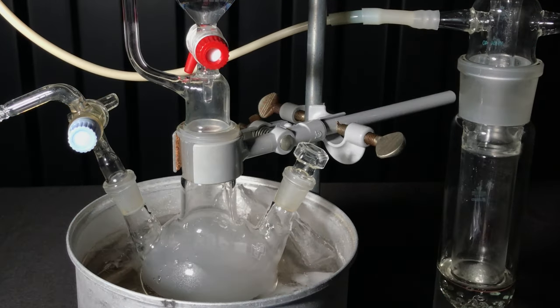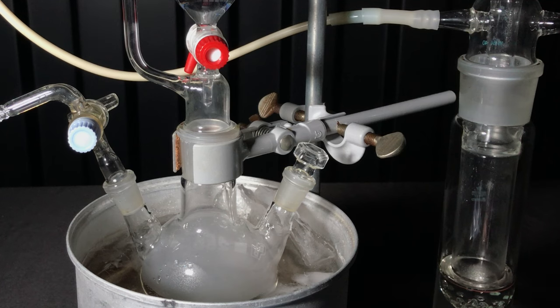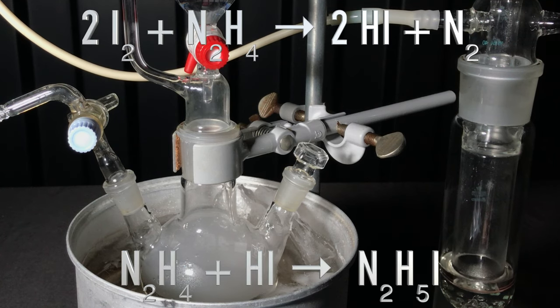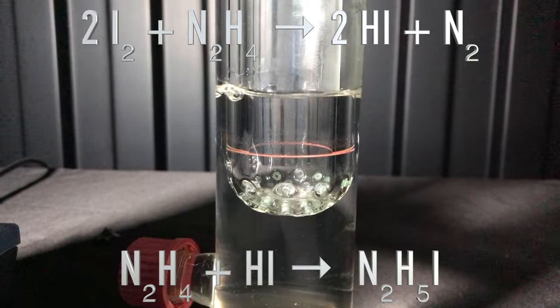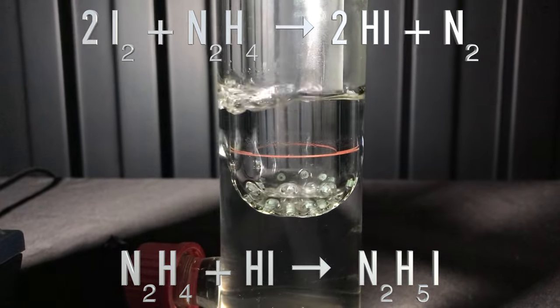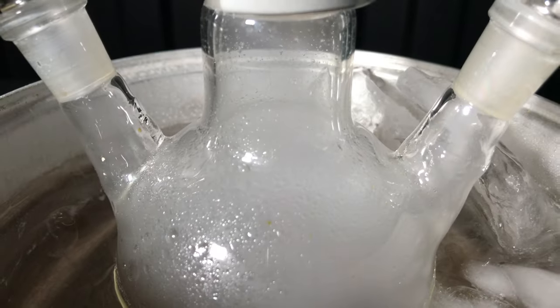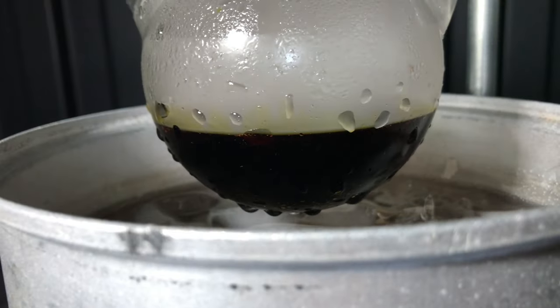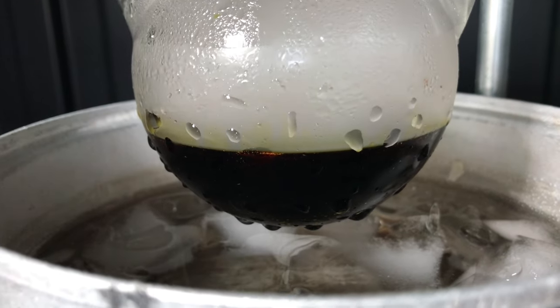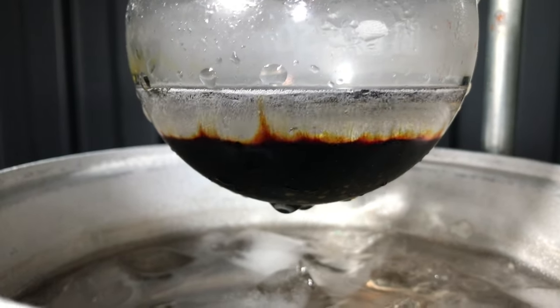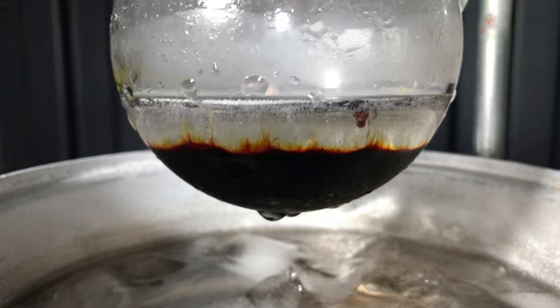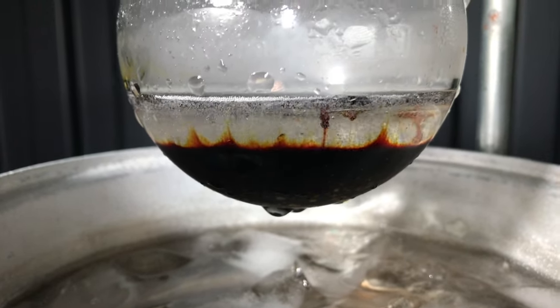You can see a lot of smoke and also gas generation. In the first step of this reaction, the iodine is reduced to form hydrogen iodide and the gas is nitrogen. The vapor is mainly hydrazine hydrate and I set up a gas washing bottle to get rid of it in the exhaust gases. Now I gotta say, this is a beautiful reaction. First it turns somewhat brown and later you get a clear color at the top and a lava lamp like effect.